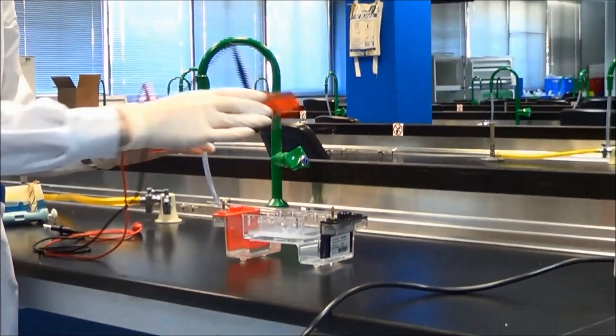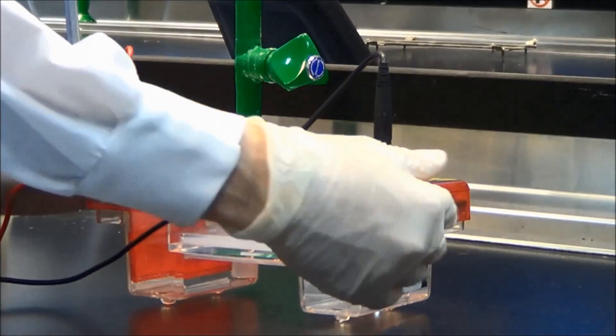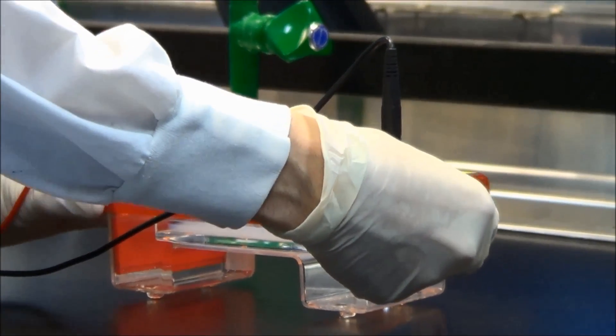Once you have loaded the gel, you are ready to connect the gel tank to the power supply. Connect the black cable to the black port and the red cable to the red port.